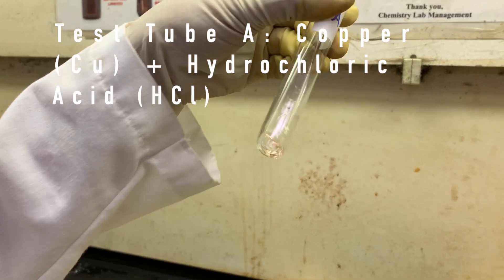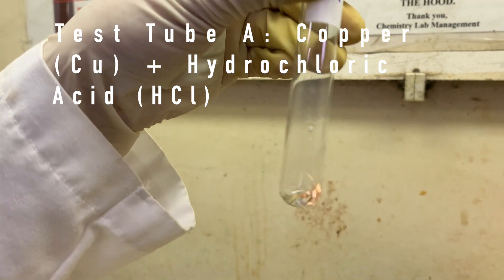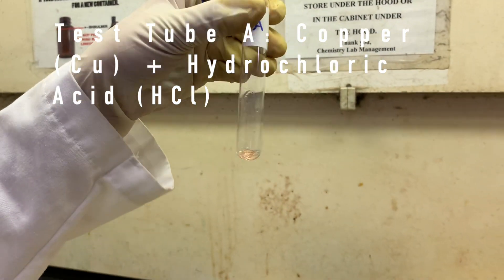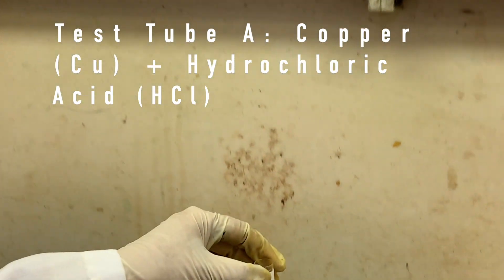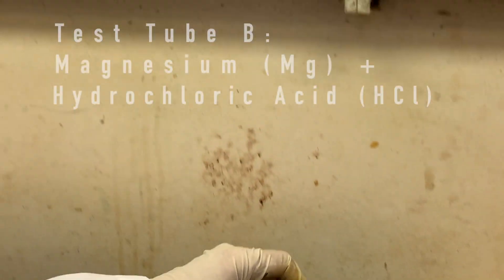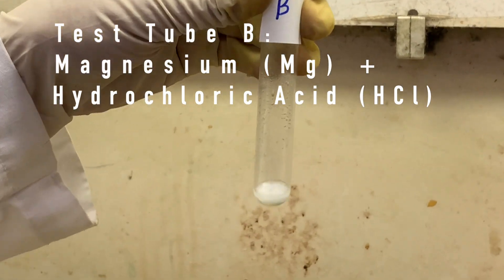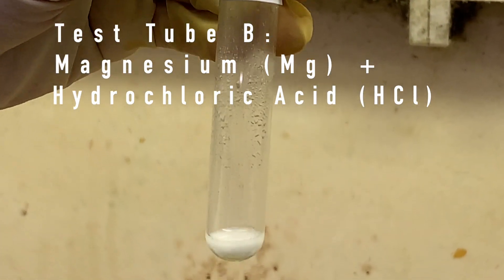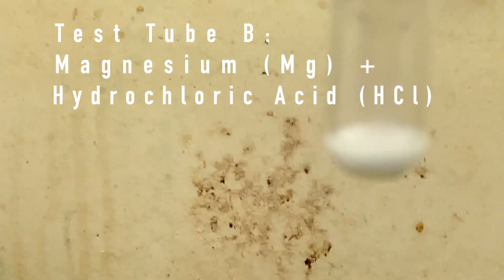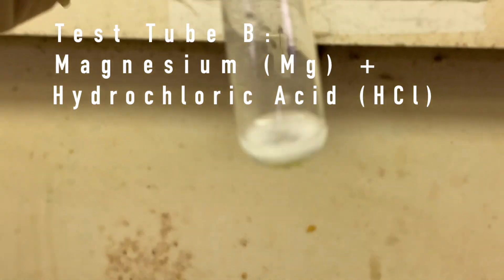A with copper — it looks like there is no change with the copper. You can record that onto your data sheets. This is magnesium with hydrochloric acid — you can see the bubbles.